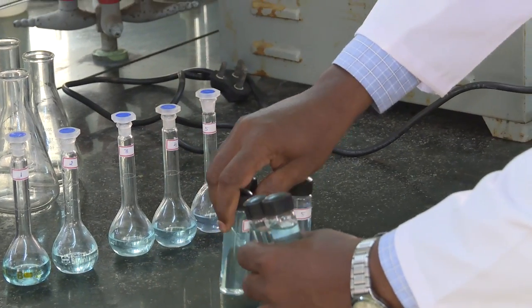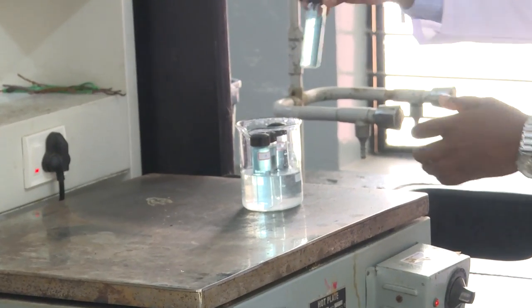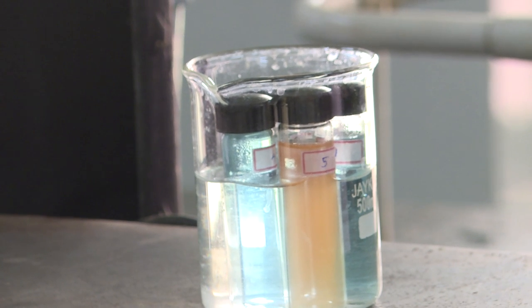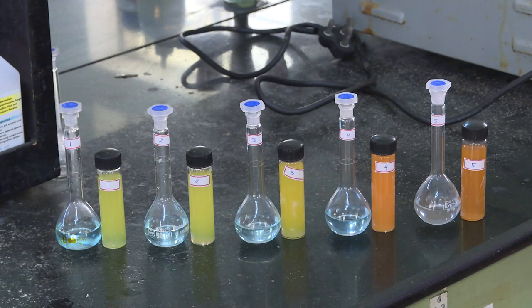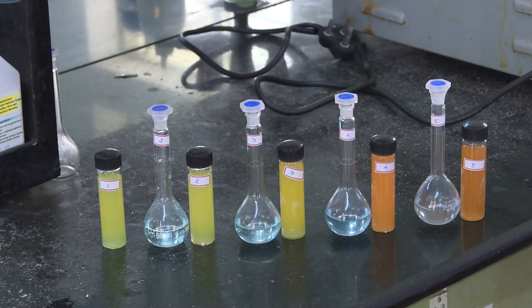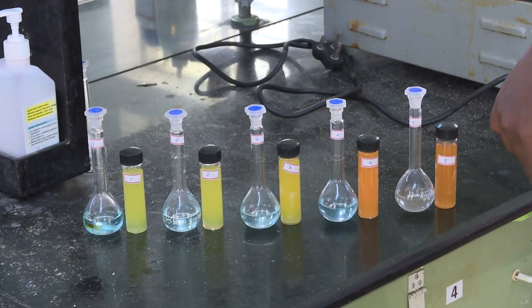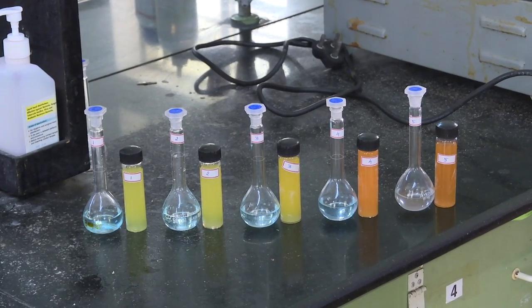We are going to transfer the samples into the water bath — a 500 ml beaker containing water — and heat for 5 minutes. After 2 minutes there is a change in color. After 5 minutes in the water bath, you can see that the Benedict solution, which was originally bluish-green in color, has changed. From the lower concentration of sodium hydroxide, the color varies from yellow to reddish. The size also varies accordingly.